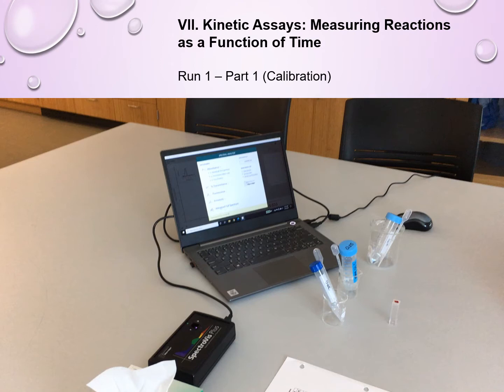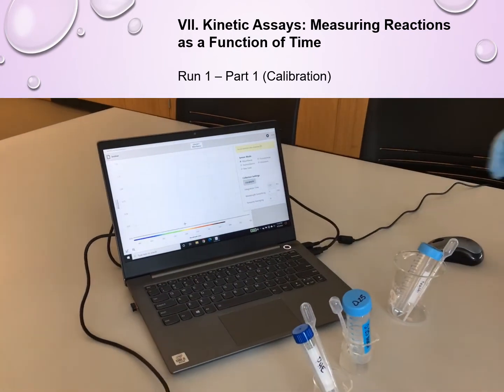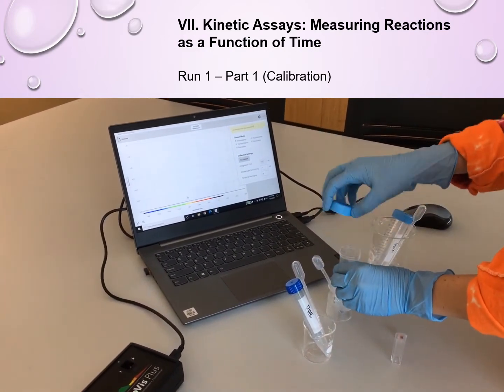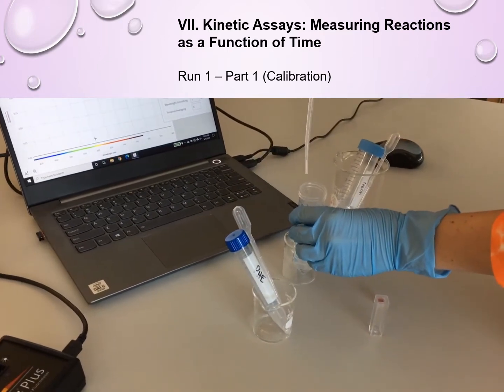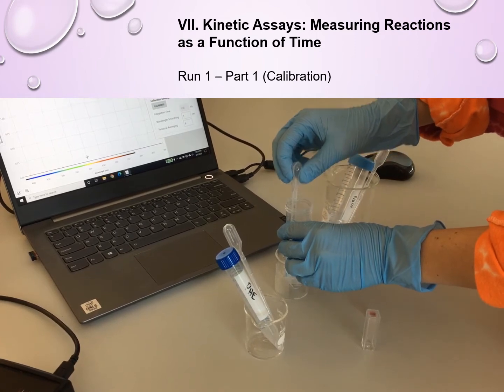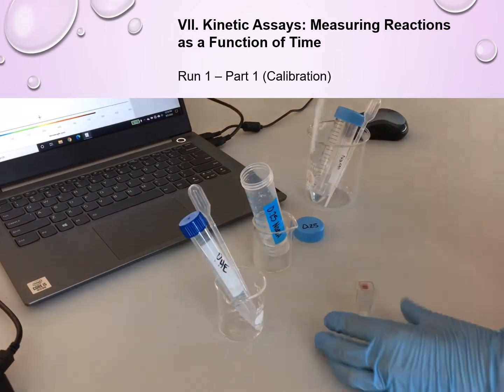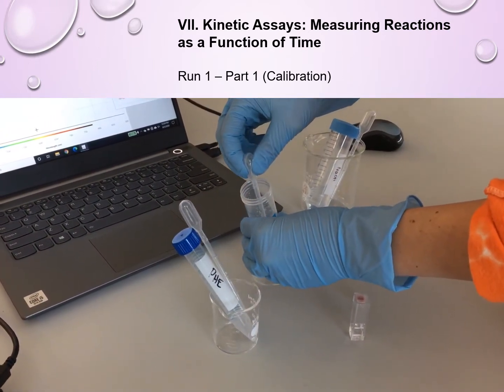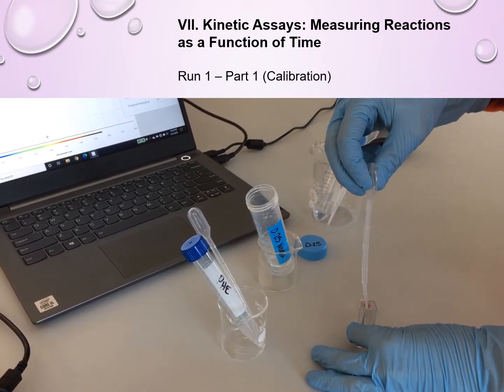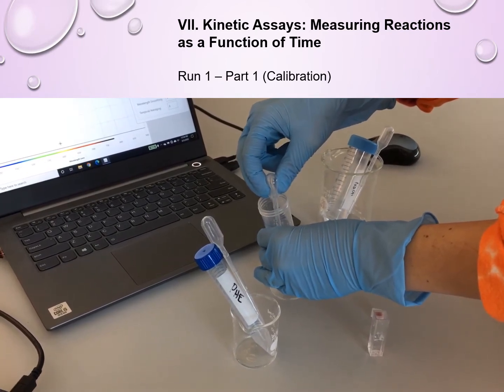So as I start playing the video, the first thing we need to do is to, again, initiate the program, and then Emily will put in the necessary volumes of the reagents as specified in your lab manual into the cuvette. So she's putting some 0.25 molar NaOH into the cuvette. She's using a squeeze pipette in this case because the volume is quite large. So it would be a little bit more cumbersome to use the micropipette. Could have been another option here.